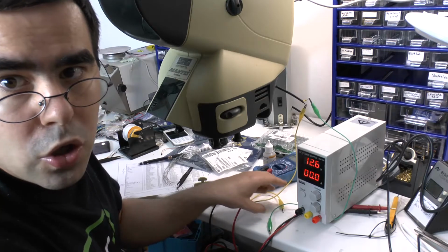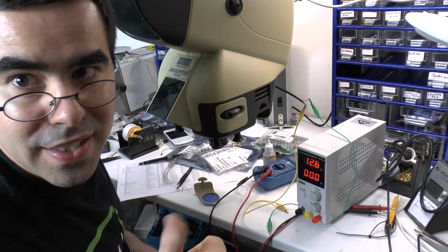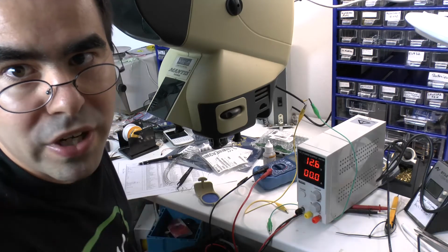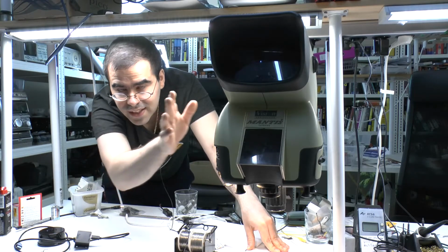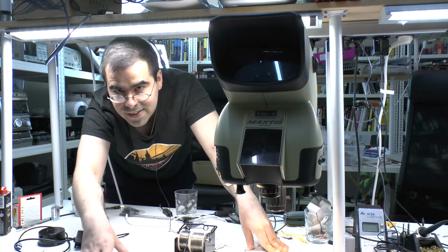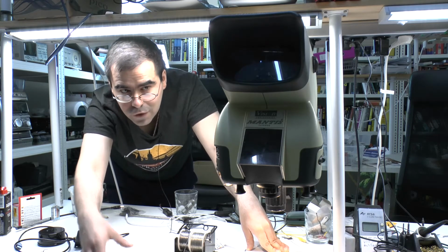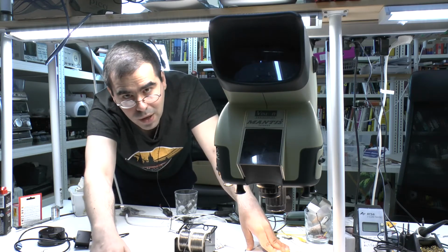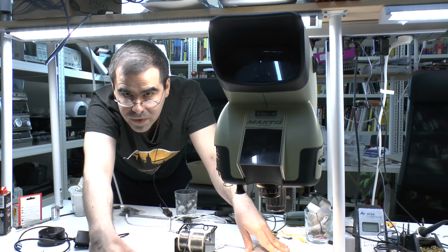Either way, we got a quick fix. Congratulations to myself, and keep fixing your lab gear if it breaks, because throwing away is easy. As you see, this is now my new facility in Budapest, and the Mantis still is here. So the repair obviously worked. And if you have one of those with a broken power supply, don't throw it away. Now you know just what to do. Thank you very much.